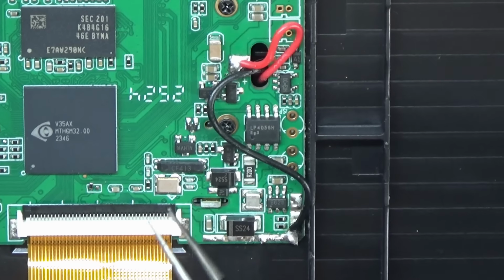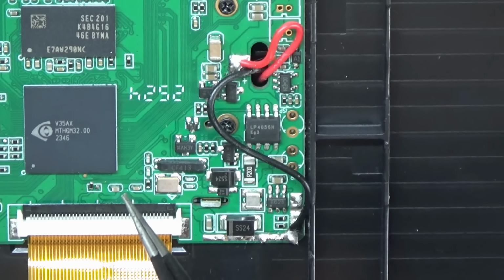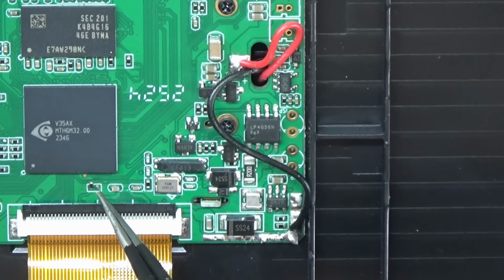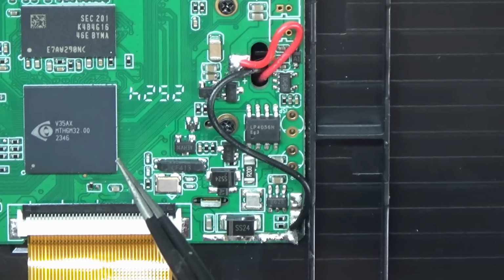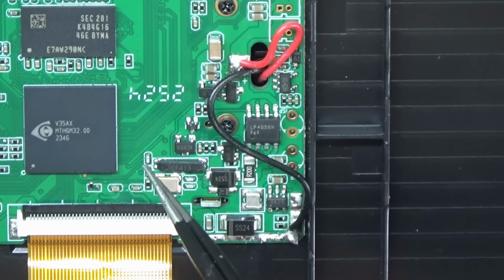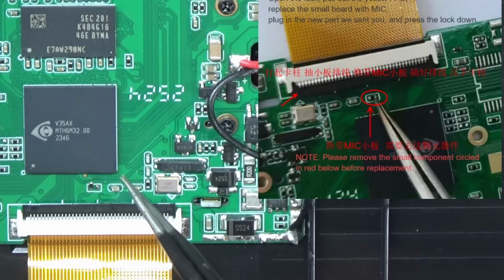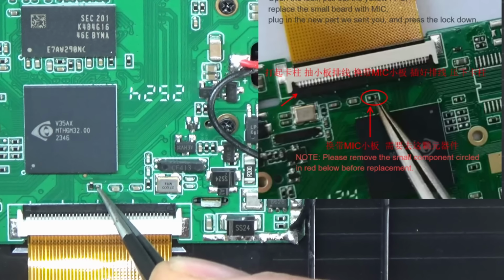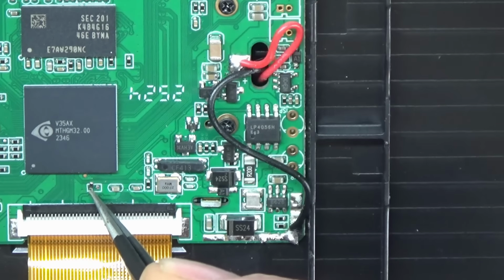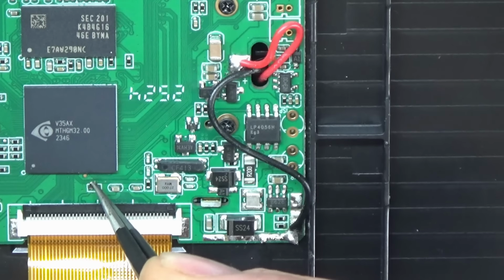Right, some progress. Now, it's been a couple of months since TOMLOV actually sent me this board and sent me the instructions on how to fit it. So I emailed them to say I was fitting the board and I still wasn't getting any sound. And they asked, did you remove the resistor? So I looked back on the instructions again, and there's a little resistor here, which you have to remove as well. So what I did, I've just desoldered it and just swung it over to one side.